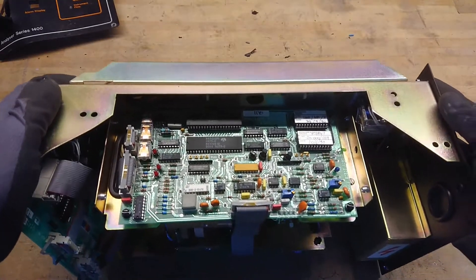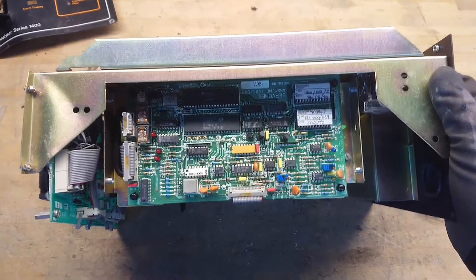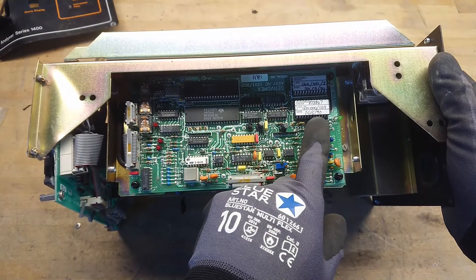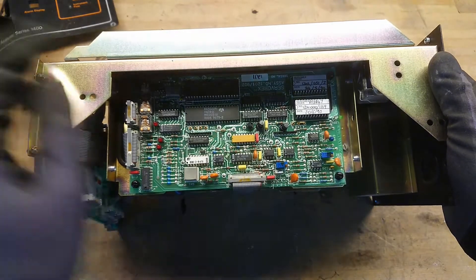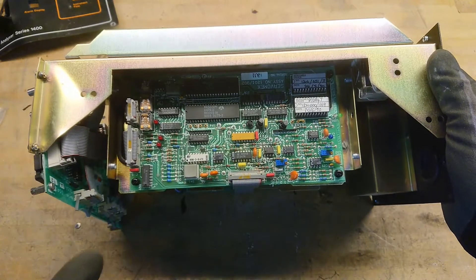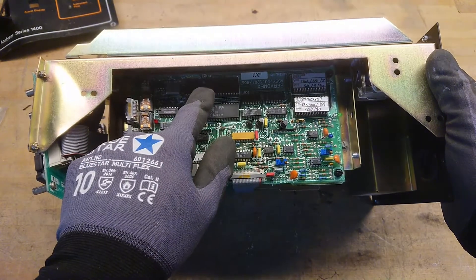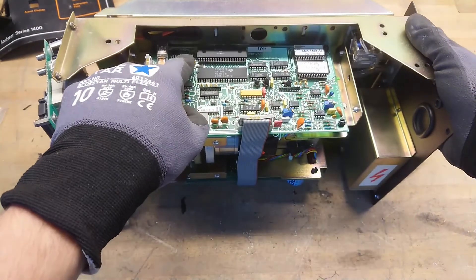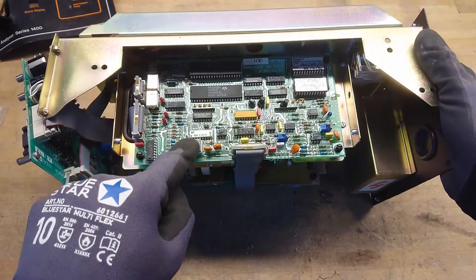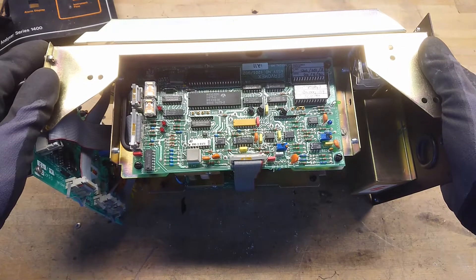Wow, this is really much better than expected. The date is the 20th of June, 1990 — this is 30 years old. Nice, fits much better to the electronics. Up here we have a Motorola MC6802 with a 4 MHz crystal next to it, and this is the ceramic package I was talking about. But look at that board layout — that's awesome.